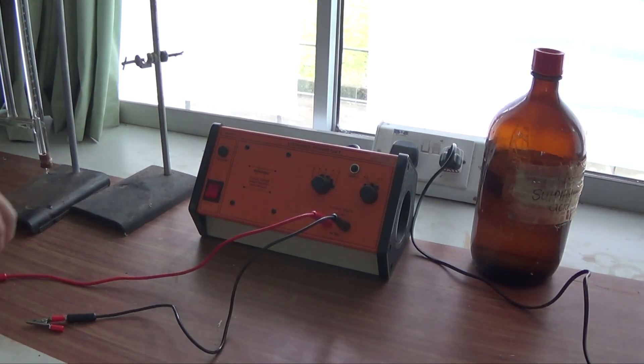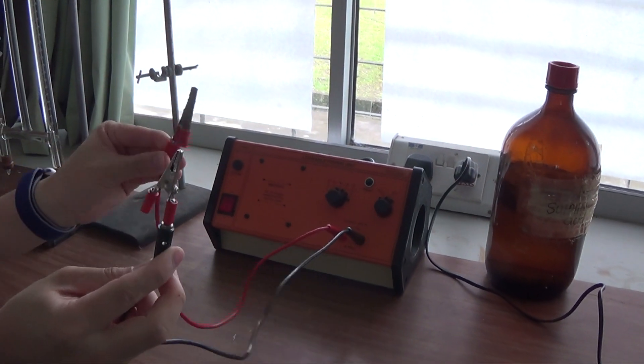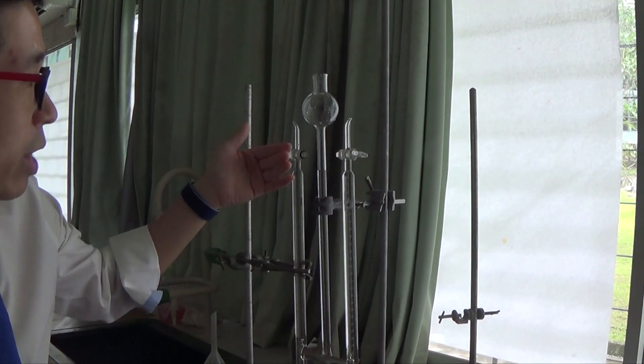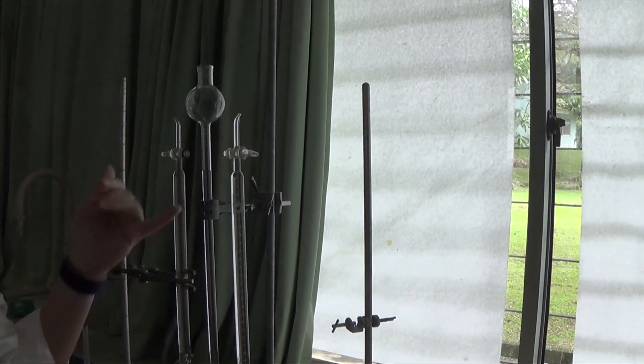And here I have a power unit. I don't know which one is positive, which one is negative, but it should be pretty obvious later on, especially when we look at the product that we are going to get here.